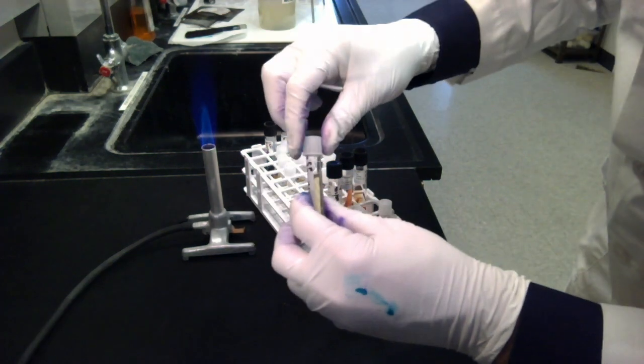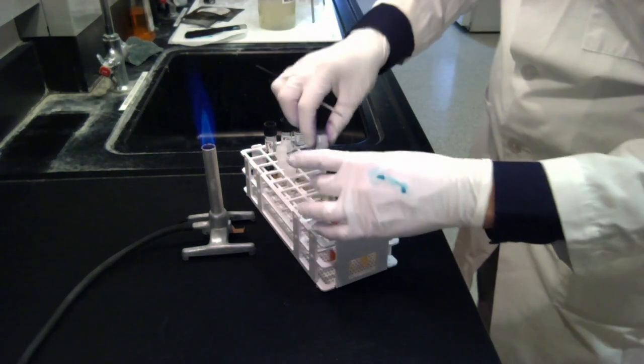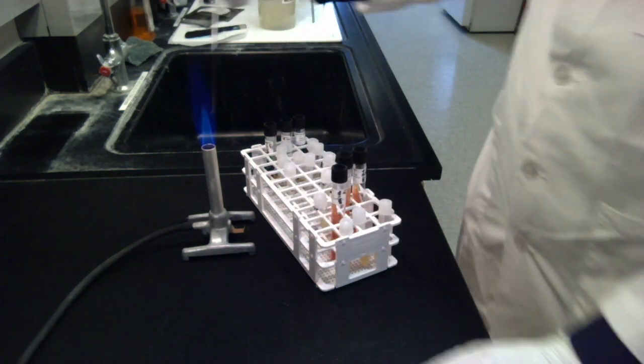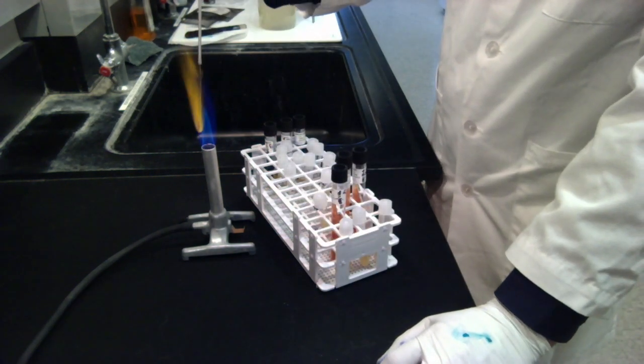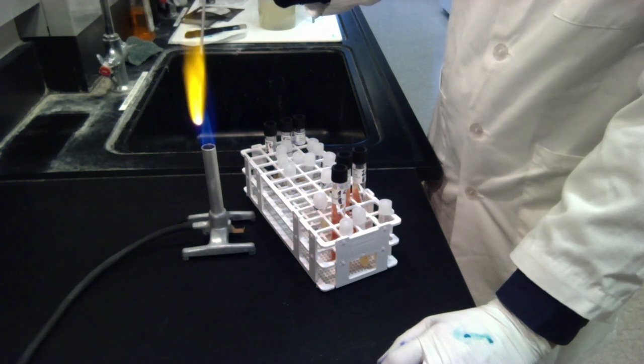With these you want to leave the cap loose. Loose but not falling off. Again, we want the bacteria to be able to breathe. And that's how you inoculate a SIM test.